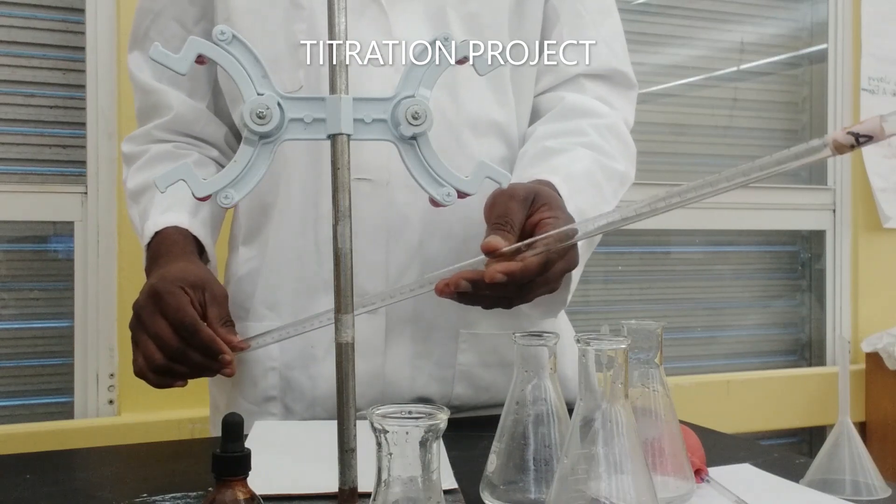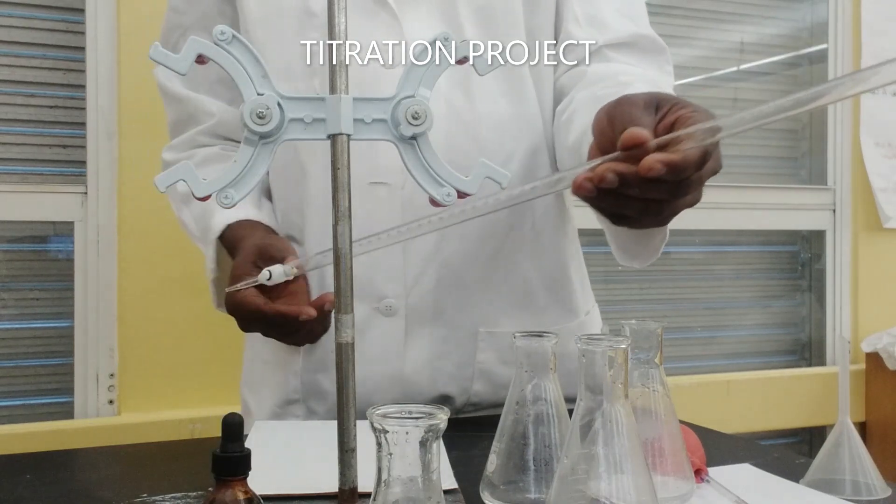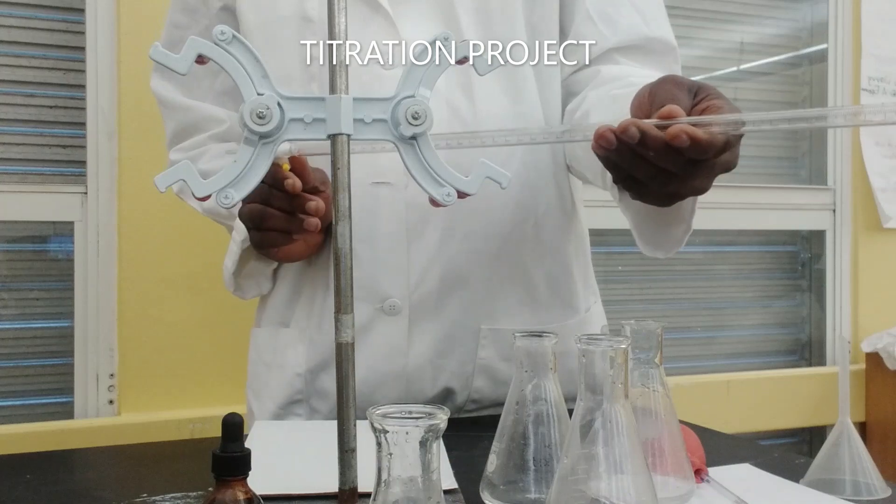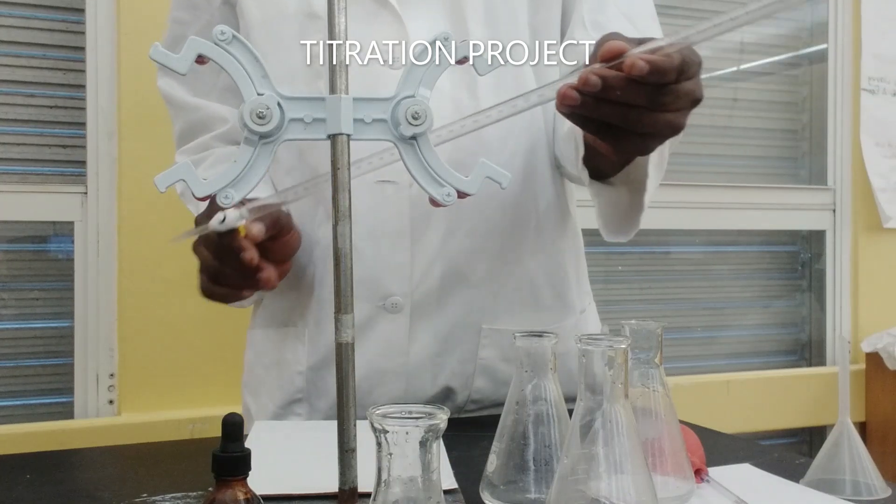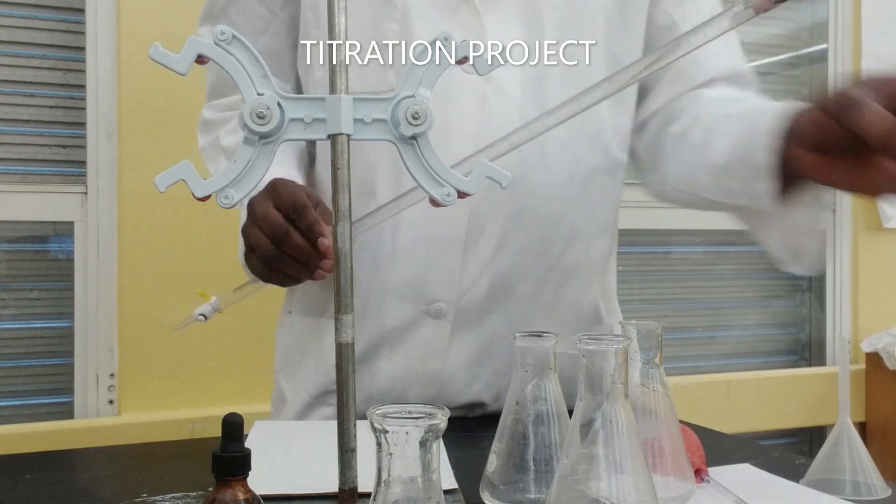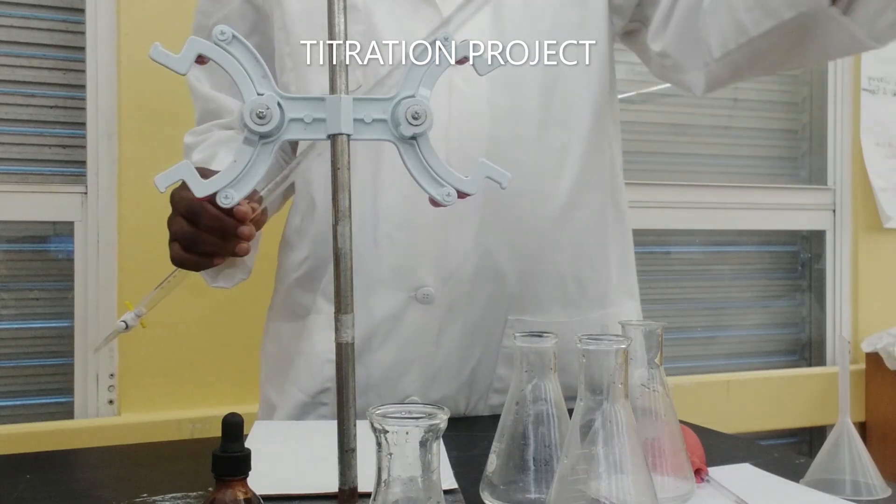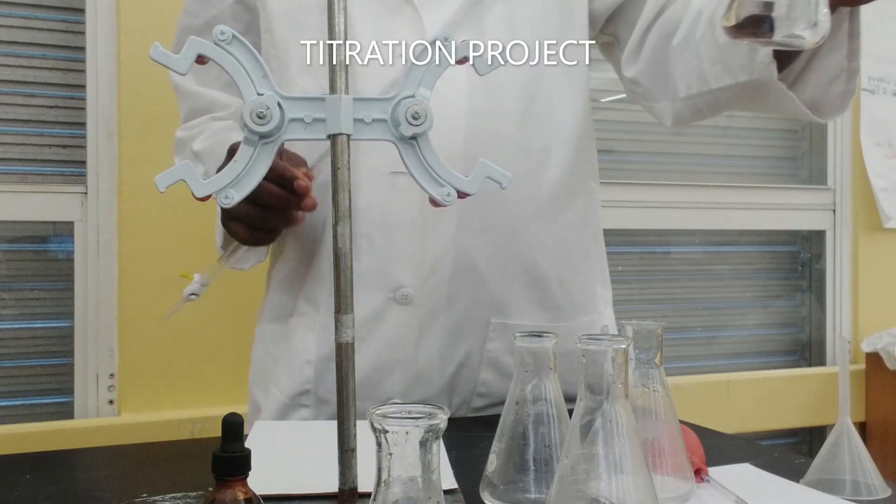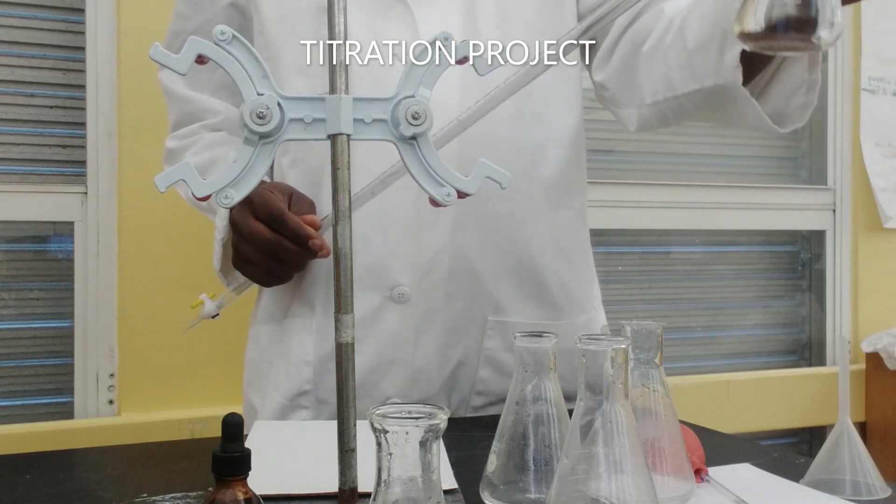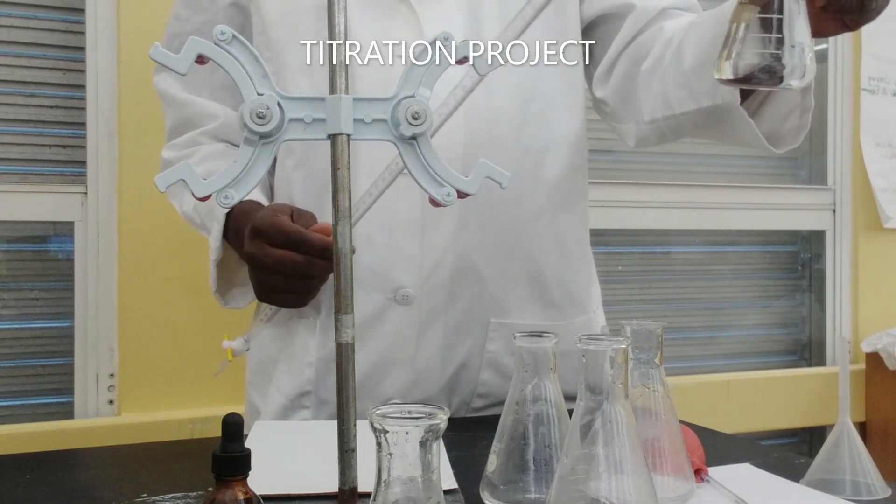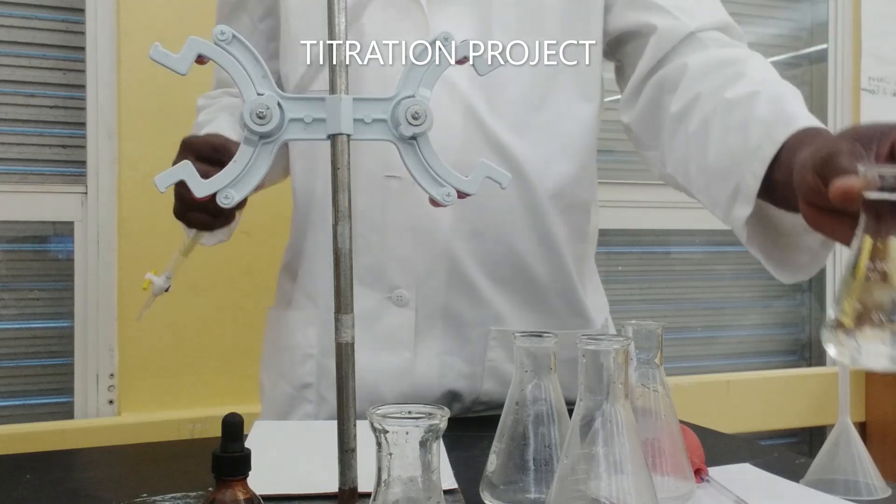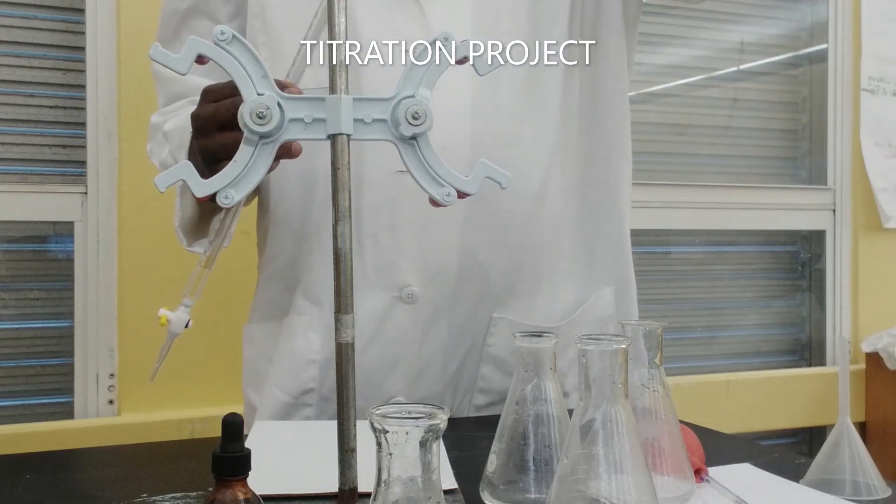Usually it's advised that you rinse out the burette. To do that, since I'm going to be putting my base, which is ammonium hydroxide, into the burette, I'm going to just put a little to rinse it out.